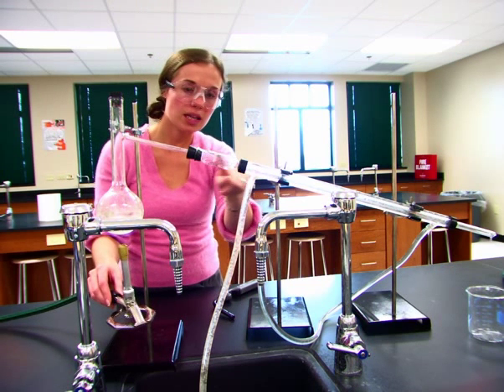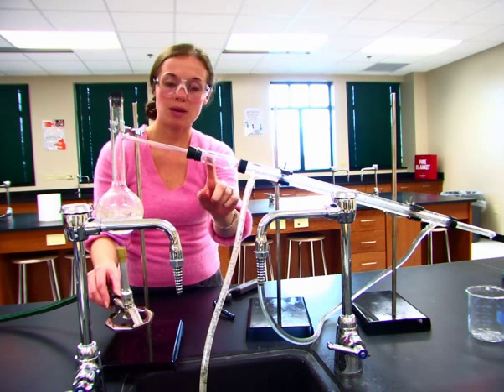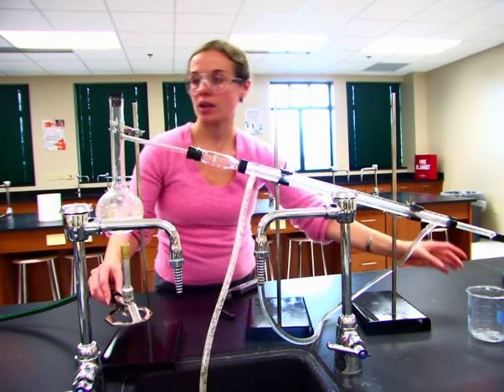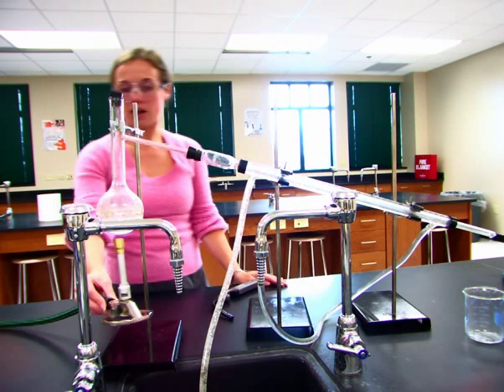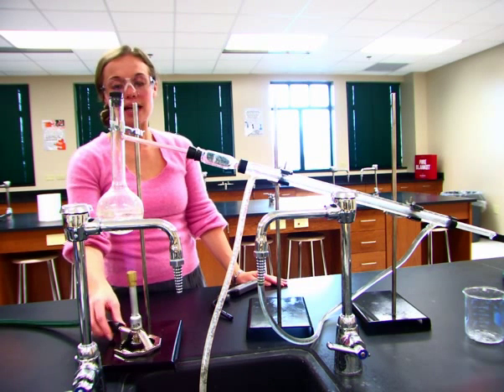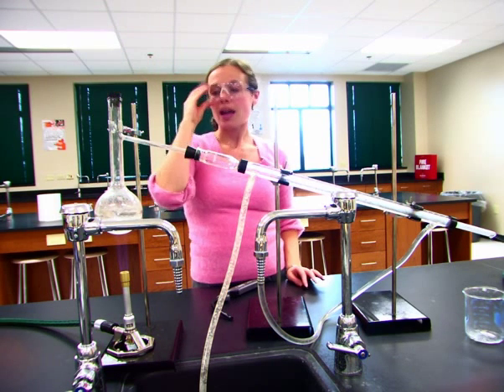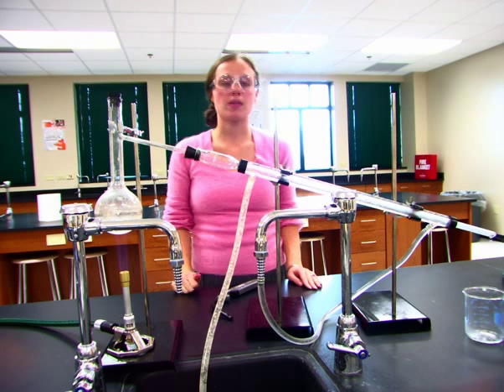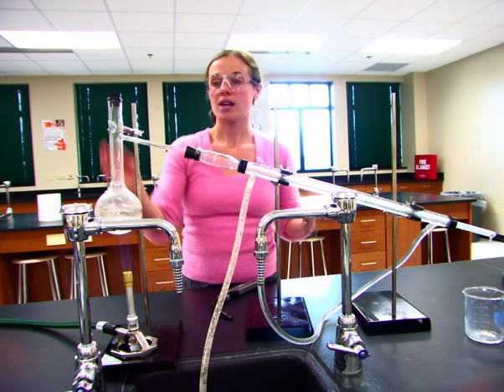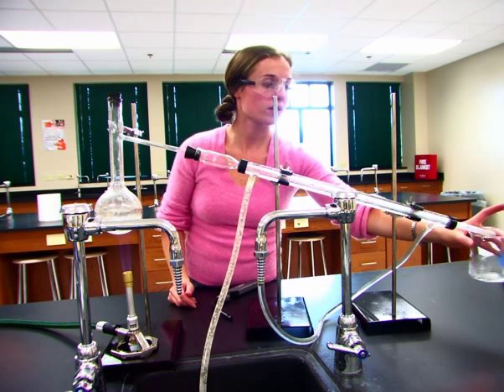If you can notice in here, we've got a little bit of streaks where some of the gas is condensing just from touching the room temperature glass, but it's really condensing through here, and we've got some drips even coming out on the other end. And we discussed in class that this can be very useful if we are, say, stranded on a boat and all we have is salt water. Well, you can do the same thing as with the sugar water, where we evaporate off the water, somehow collect that vapor, and then we have good drinking water.